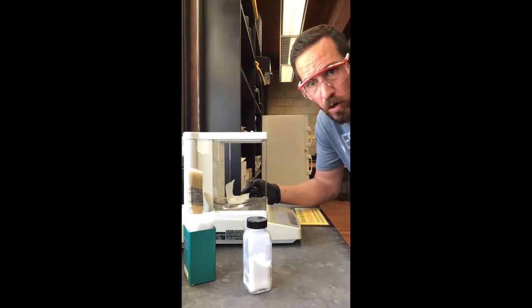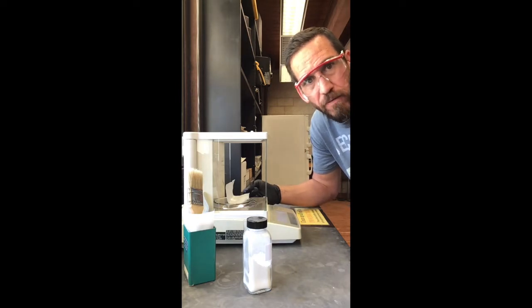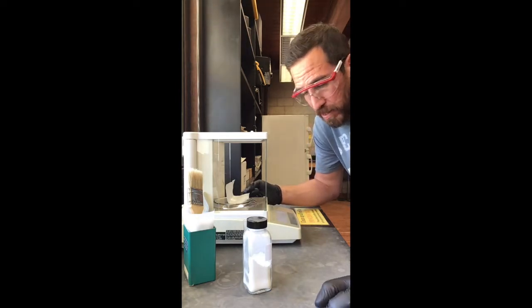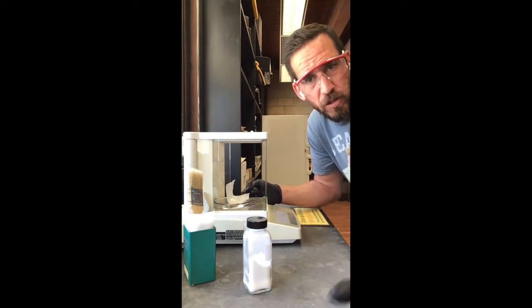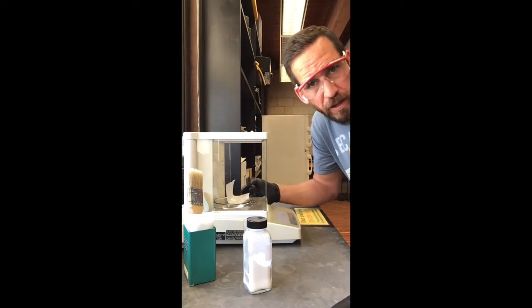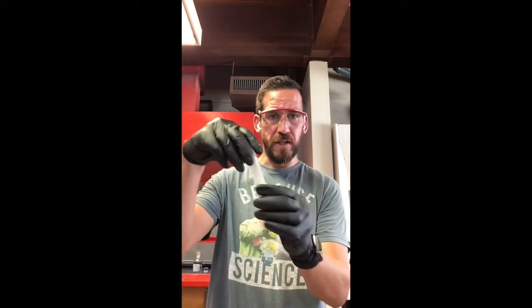So if it's 0.071 or whatever, or it's even like 0.075 or 6, 7, 8, it's fine. It's not that much of a difference, and to save time, you just kind of move quickly and get it on there, and then record what you actually have. Okay, so there we go. All right, so now that we've got our approximately 0.070 grams, I ended up going with actually 0.08 just because I can. And now what we want to do is place that inside of the centrifuge tube.